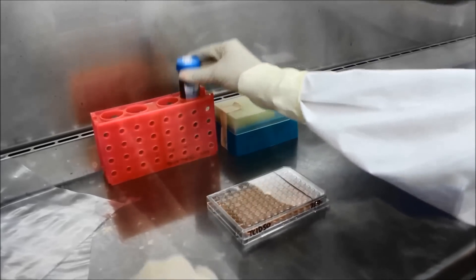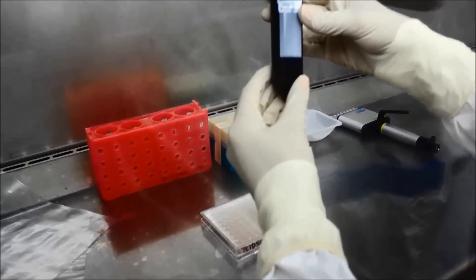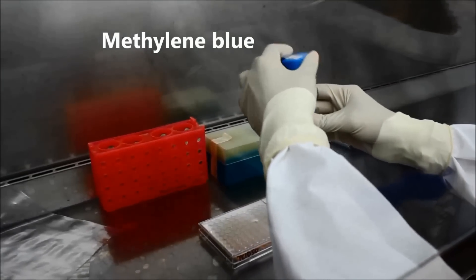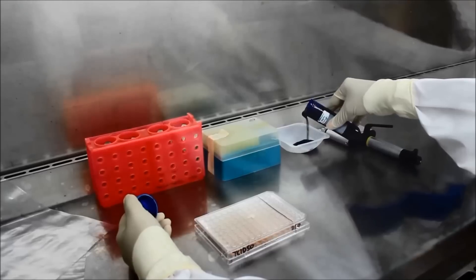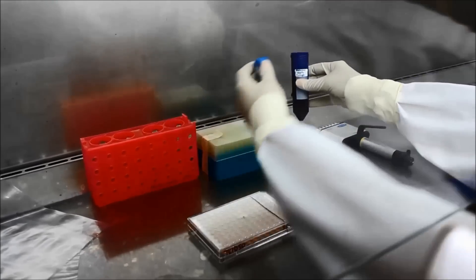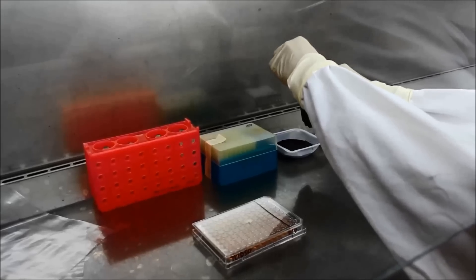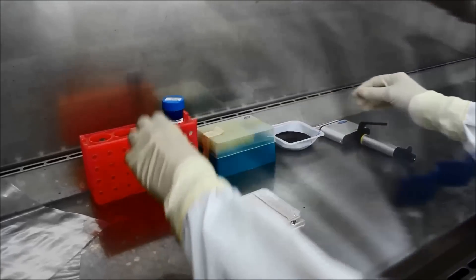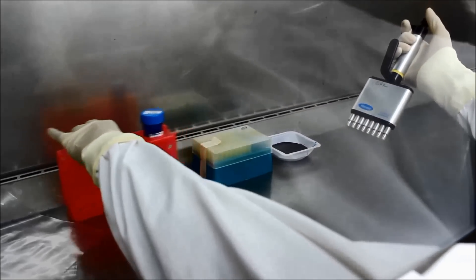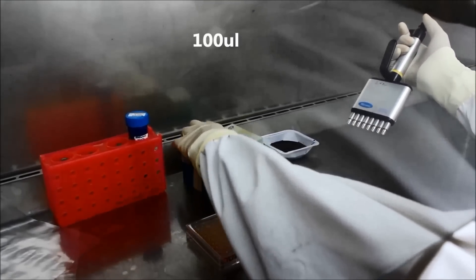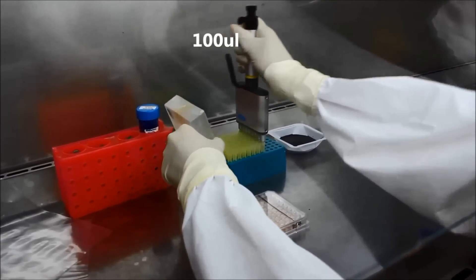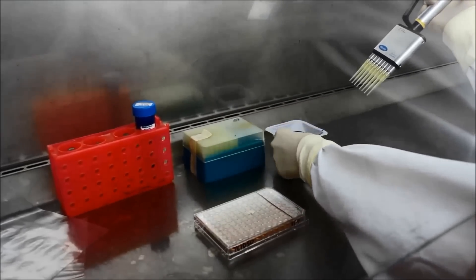Stain your TCID50 tray in the biohazard hood. Add 100 microliters of methylene blue to each well as shown. You do not need to use a sterile tray for this.